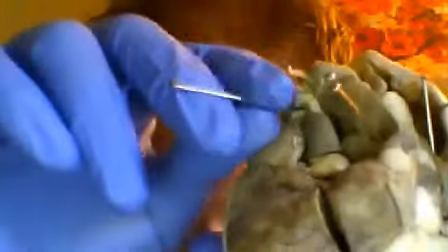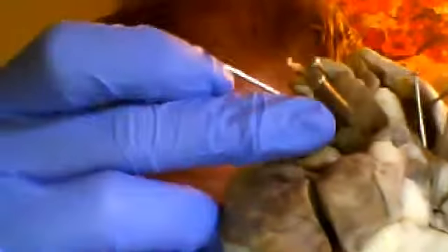Now, for the aorta, which I've pointed out for you, it's right here, this area right here. The aorta actually pumps blood throughout the rest of the body through its several branches. You have the aortic arch, which branches off into several arteries, and the aorta sends blood throughout the entirety of the body, and so it's a very important blood vessel.